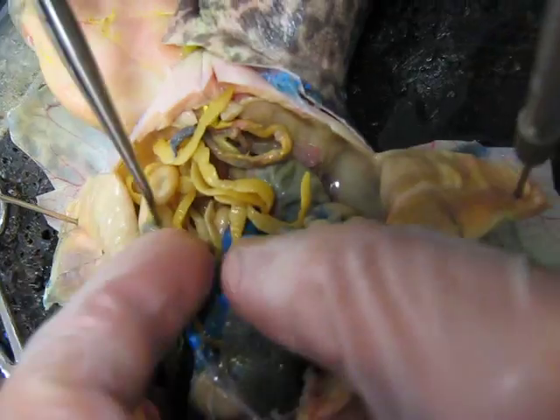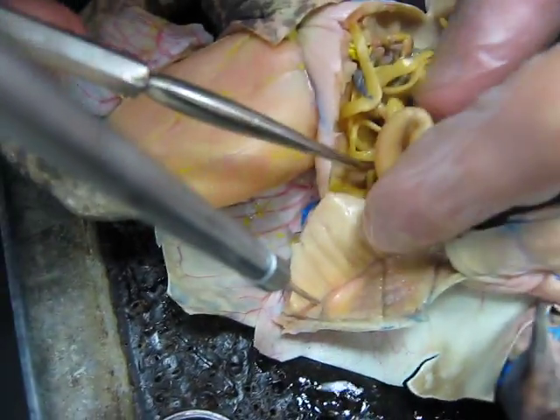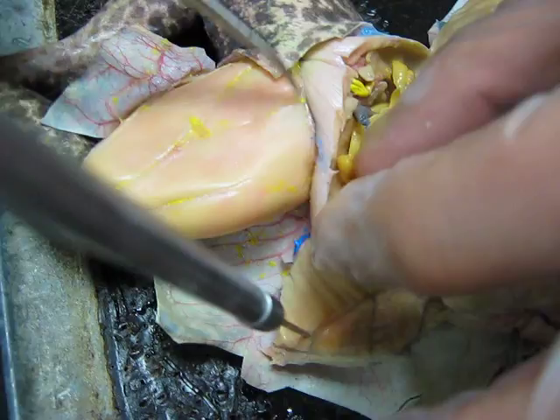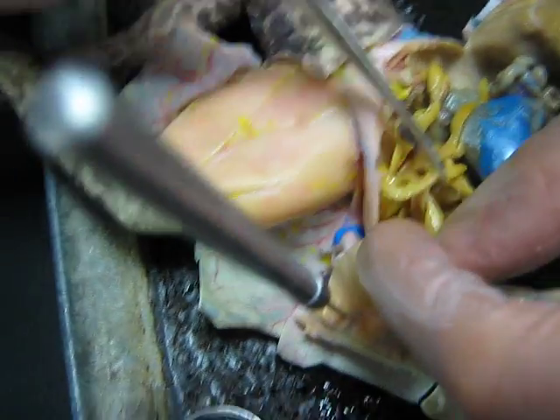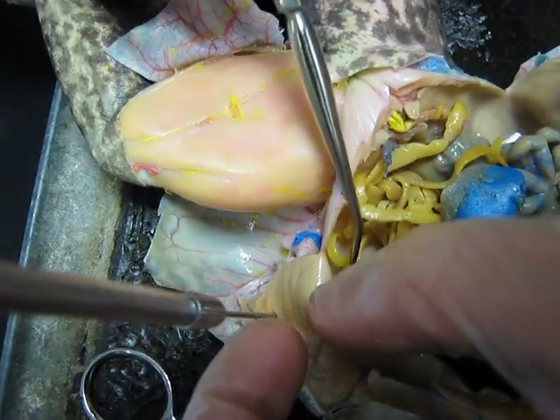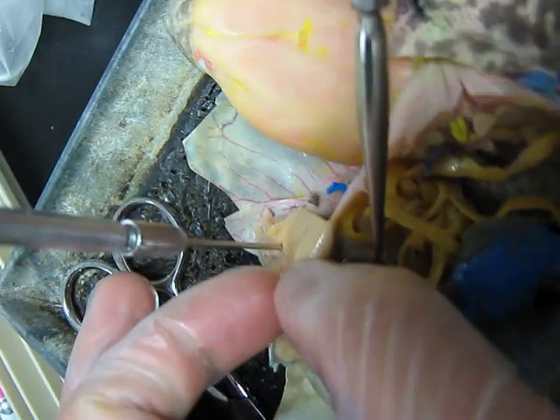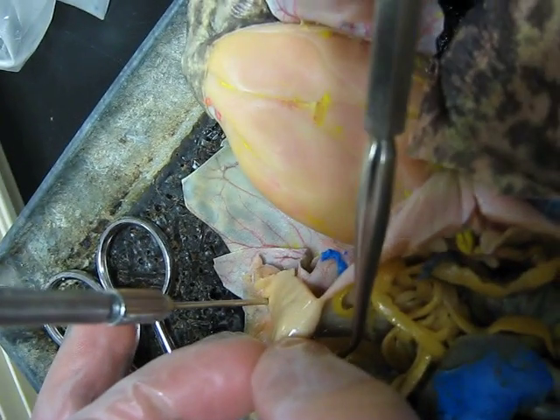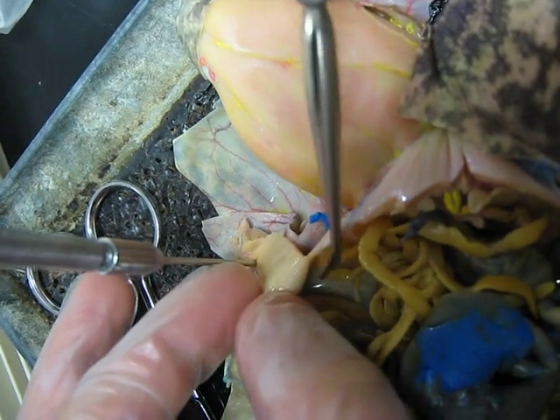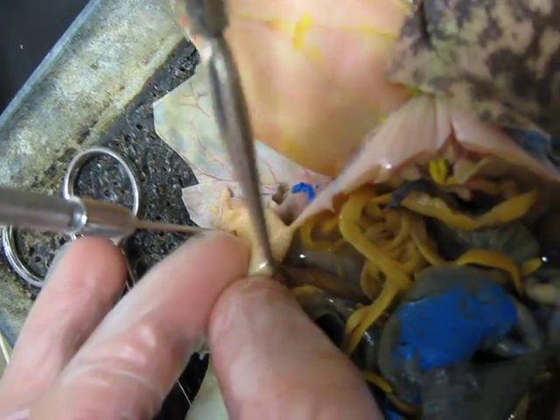So we have the stomach here. Under the stomach is a lining — the pancreas. The pancreas is this lining under the stomach.